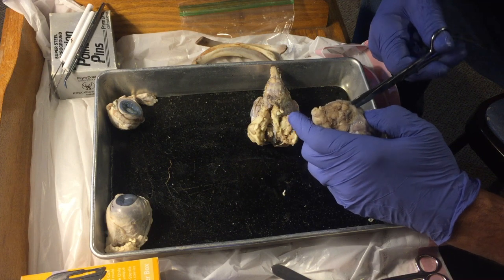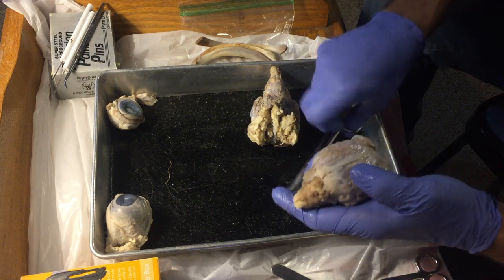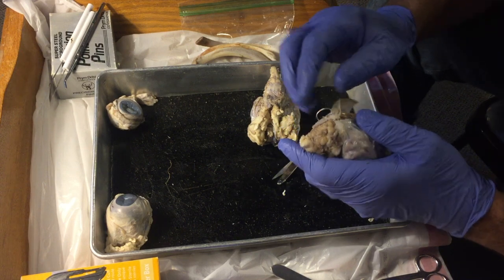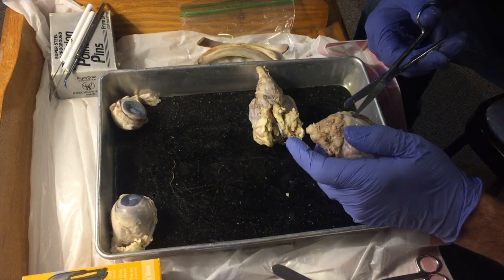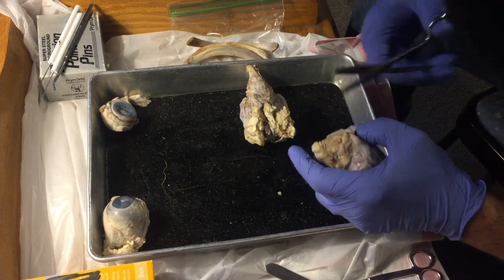The meninges descend down here, deeper in, and I'm going to see if I can peel them back. I might have Becky pause the video from time to time, not right now, but if I need to do some dissection that you don't need to watch the minutia of. But I'm going to see if I can get that out of there.